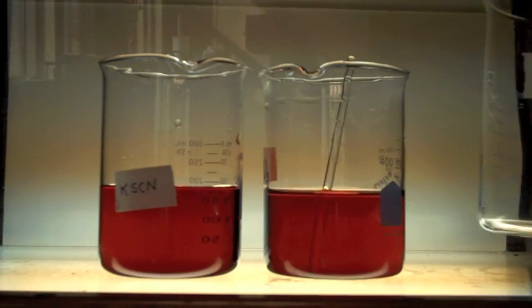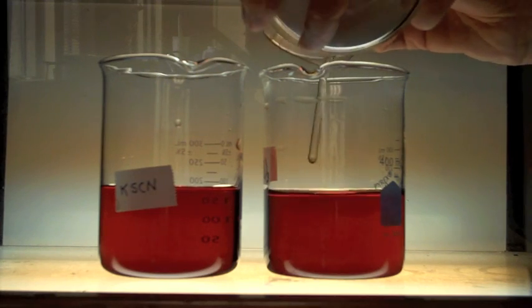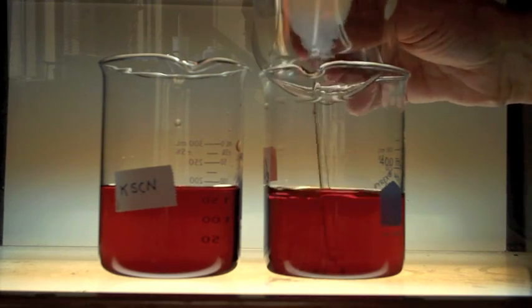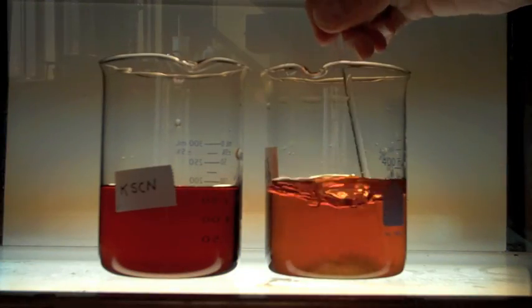Now let's add some potassium nitrate salt. Do you see any difference?